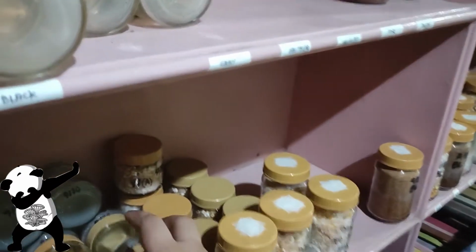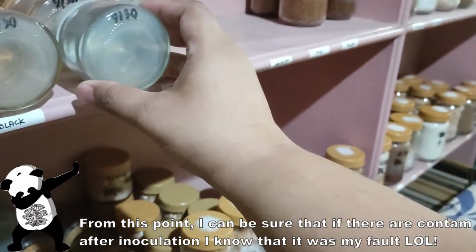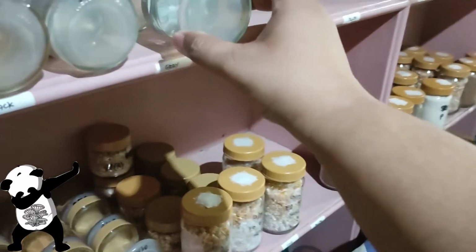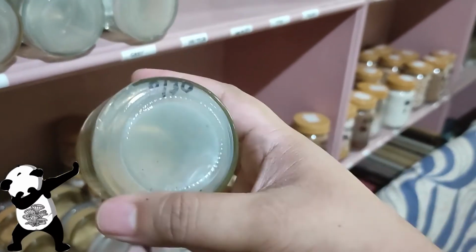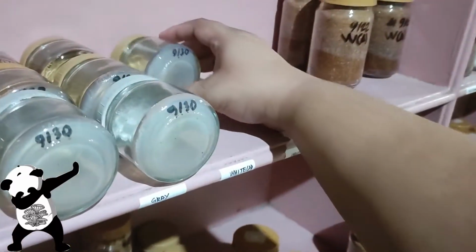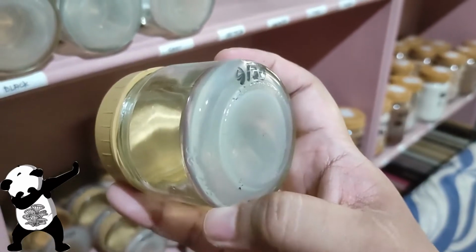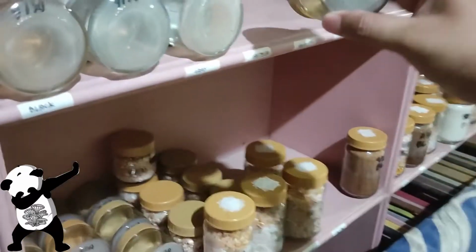So if in any case I do some inoculations and suddenly they got contaminated or any other issues, it's my fault for having a not so clean surrounding. But right now I'm actually doing inoculation of PDA inside still air box. I'm not gonna do an open air ever again. So that's a really brutal learning for me, because previously I do have some success open air inoculation on PDA, but the last time that I did it, I suffered, let's just say, 100% contamination.